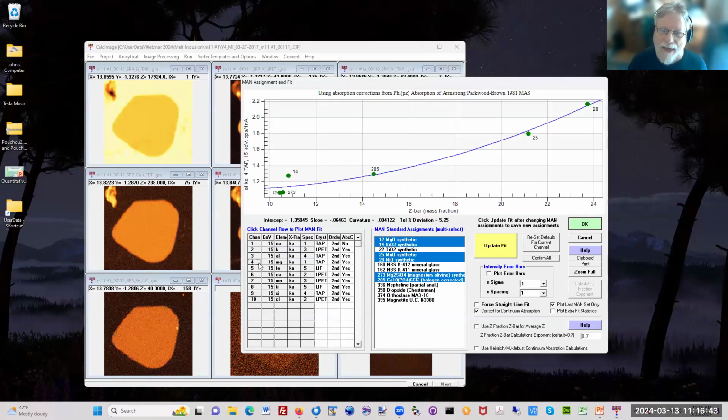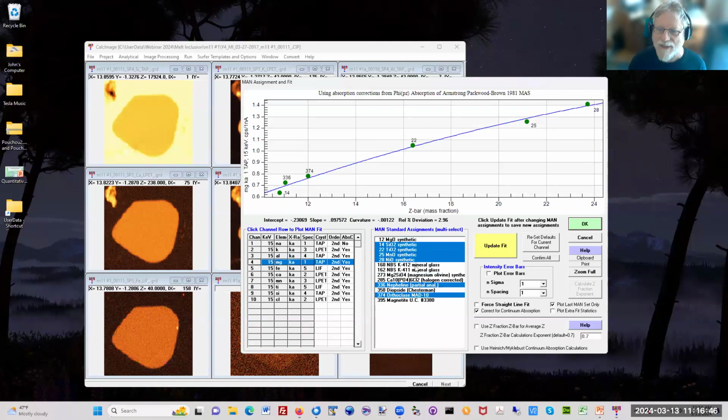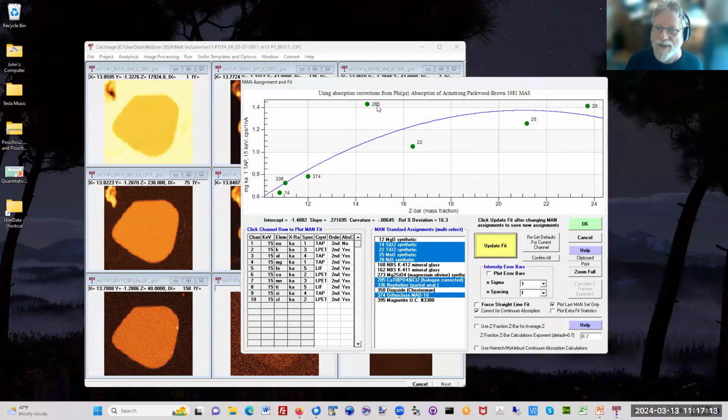Aluminum. And the idea here, by the way, you notice that some of these materials are not selected, and that's because, of course, this is the magnesium K alpha, but you obviously don't want to measure magnesium in magnesium oxide to get the background, because you won't get the background. And even in some cases, you could say, I'll select this halogen, this apatite, and I'll update it here. And you'll see that it's an outlier. And why is that? Well, it's because calcium second order, or third order, interferes with magnesium K alpha.